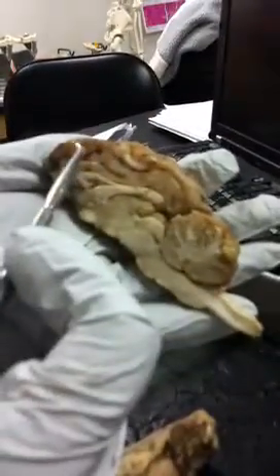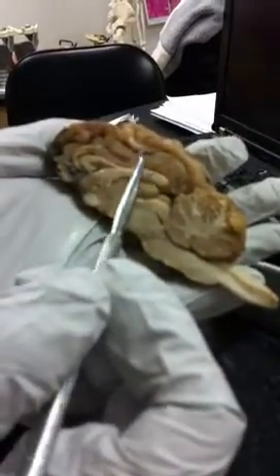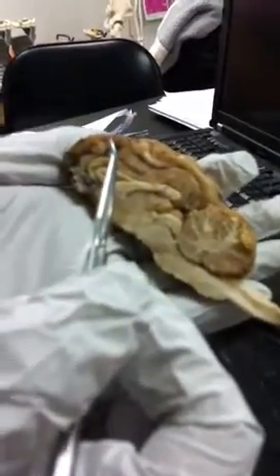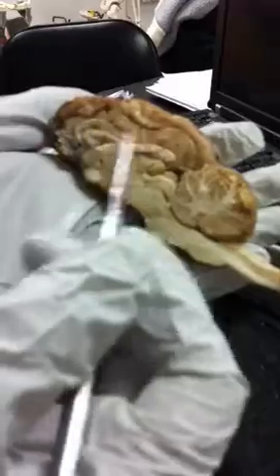We did the longitudinal fissure, the cerebral cortex. Remember the cerebral cortex? That's what really got me on my picture of drawing that. But I can't remember the names of them. Wouldn't it be just all these are cerebral cortex? All the gray matter. Yeah. We did the cerebral cortex.